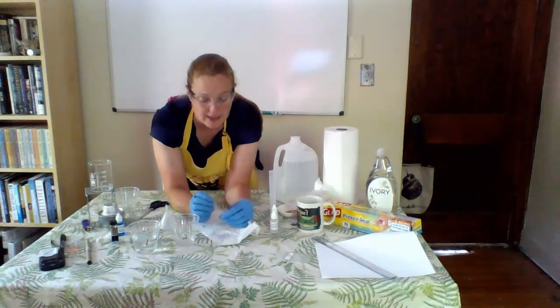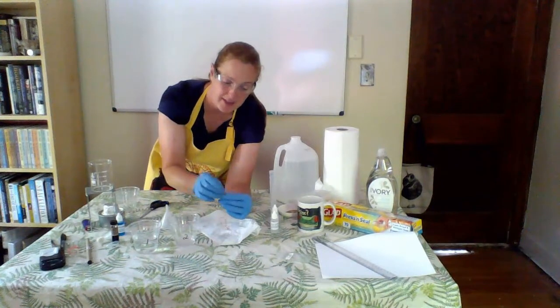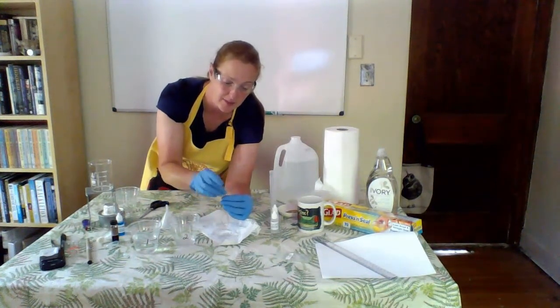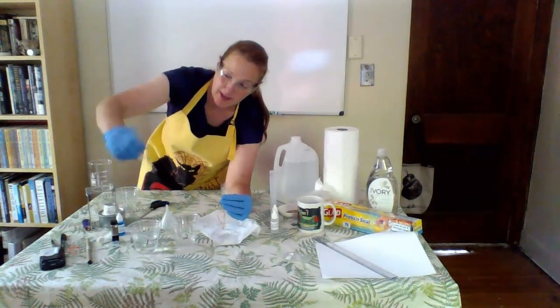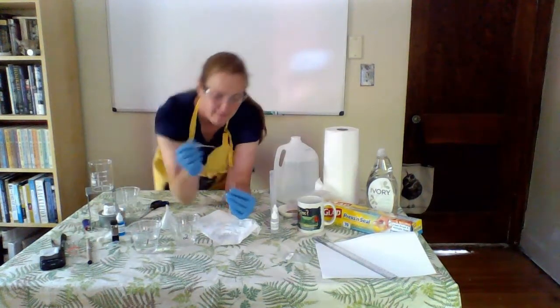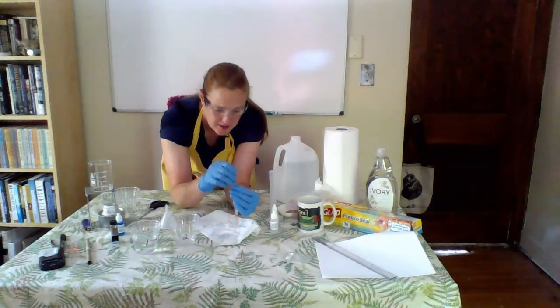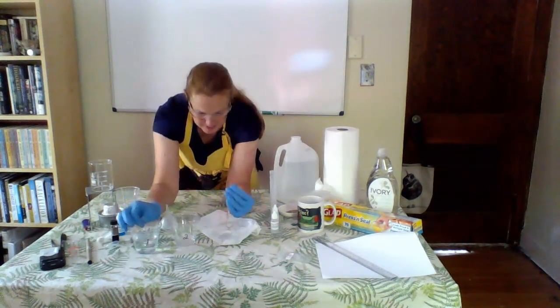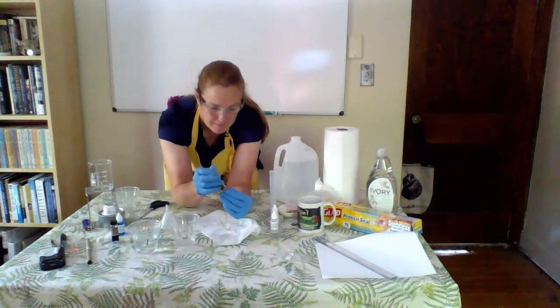I'm now wiggling my tube. This gets the tube to separate. I'm going to test it for any leaks. The way that I'm going to do this is I'm going to take my little pipette and my distilled water. I'll put a couple milliliters into my model cell. And I can already see I got a little bit of a leak.